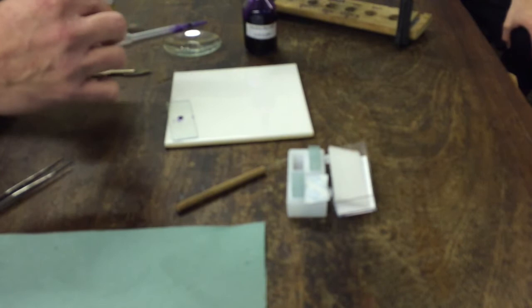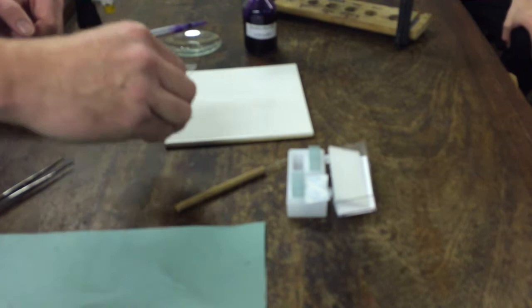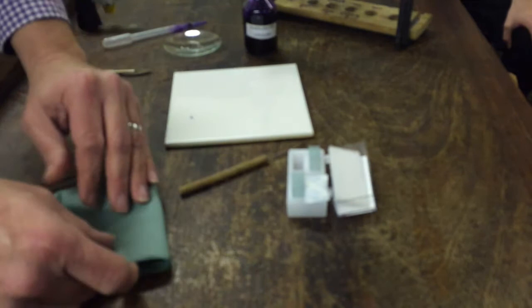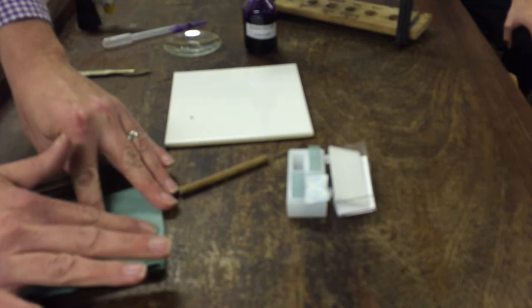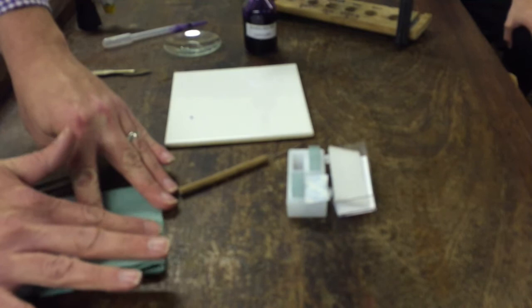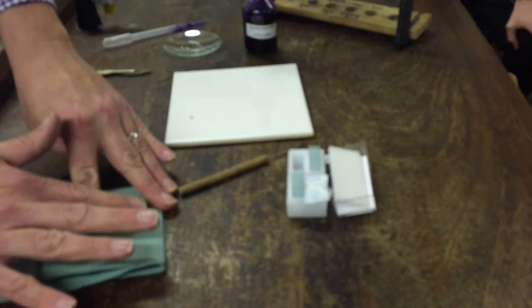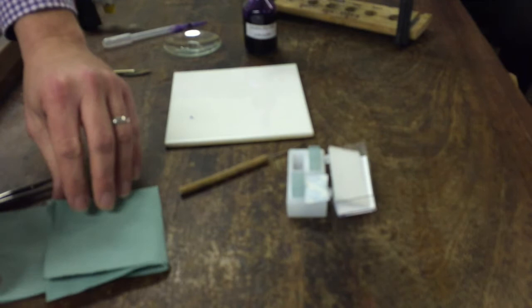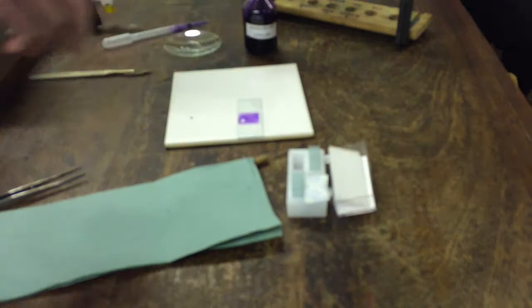Try and soak some of it away using the corners of the paper towel. I don't want to disturb the actual cells. It just basically sucks it in. Once you've sucked away quite a bit of it, drop it on from the side. You put it down its edge and just drop it. Now take it, put it on your piece of paper towel, fold the paper towel, and just very lightly touch it on the edges. That will draw out any more excess dye around the edges. Don't squash, just dab lightly. It'll also remove any other excess dye you've got around the slide which you don't want to get on your fingers. At that point we don't need to wear our goggles anymore. We're ready to start doing the microscope work.